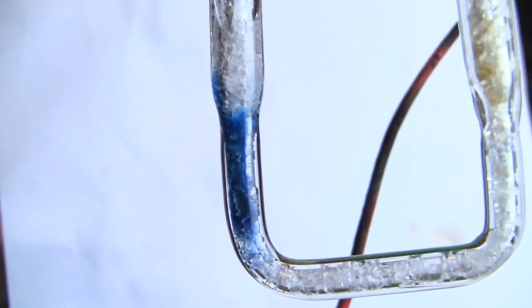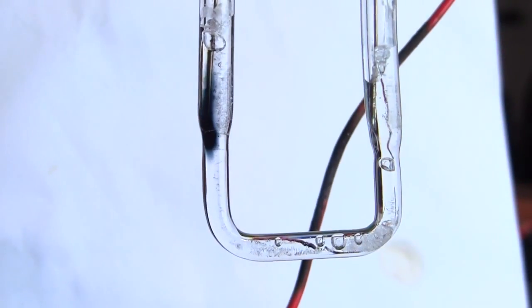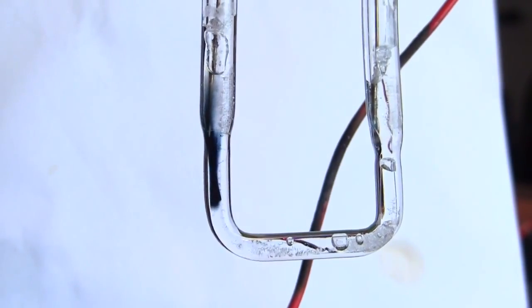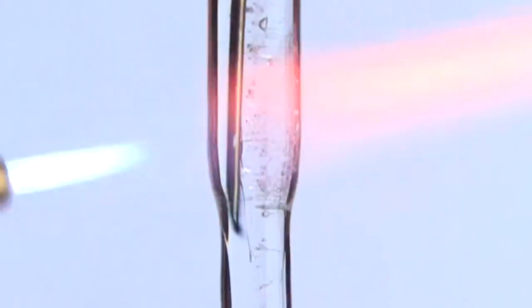Right. See if that survives till tomorrow. So what is it? I'm not entirely certain. It's probably a variant on solvated electrons. So these are just sort of electrons that are sat there in solution.